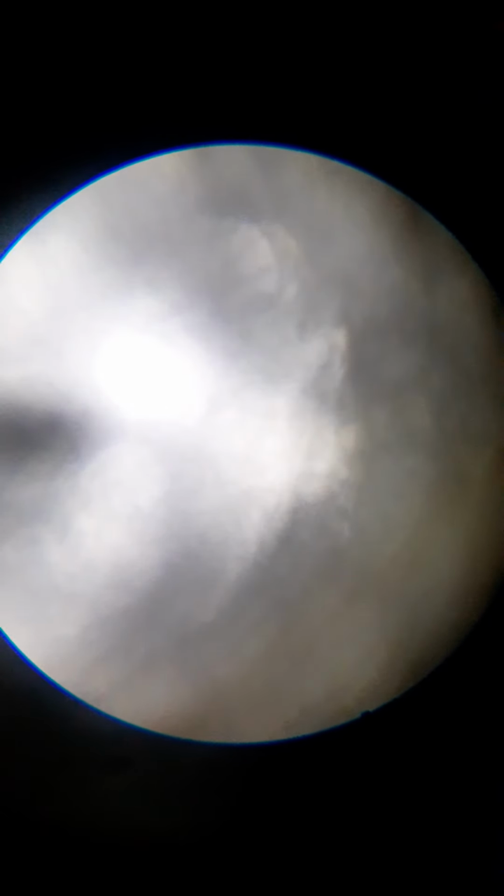With how long this is taking, I'll just kind of explain a little bit. This solution that I put on has a lot of salt in it. Every solution that you have, you are working with solvent, which is the liquid portion, and solutes, which is the particles inside of the solvent.